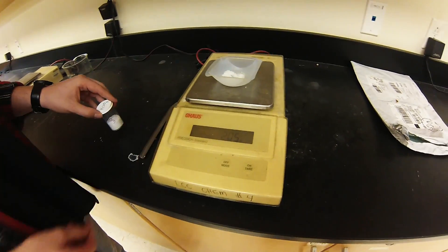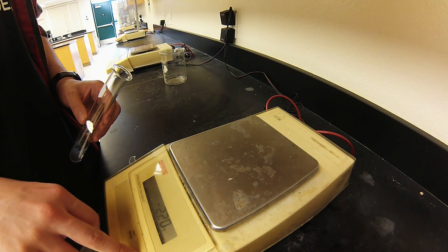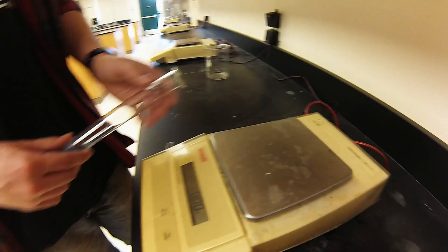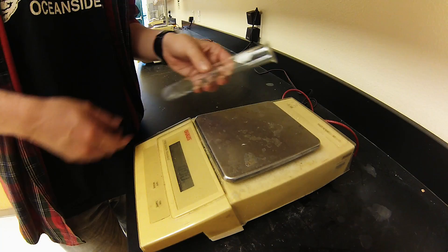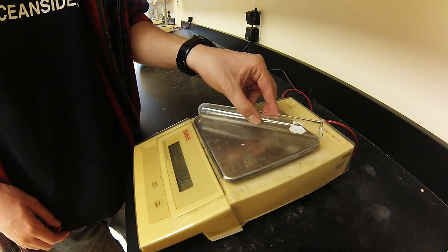That's what it will look like. Before you put the compound in the large test tube, you're going to want to weigh it out first because we'll be weighing the finished product afterwards.